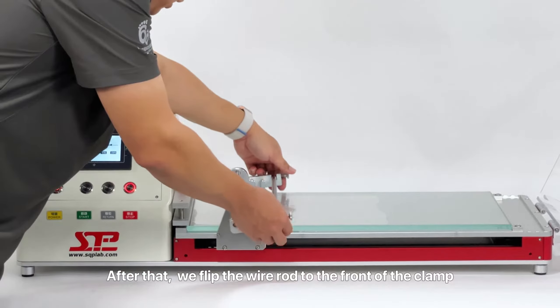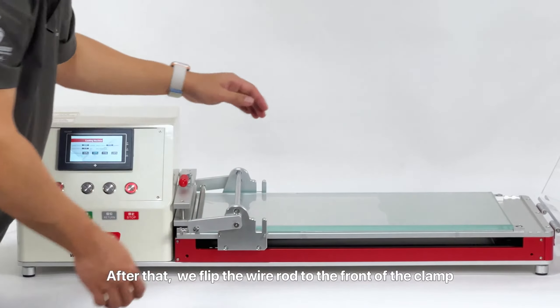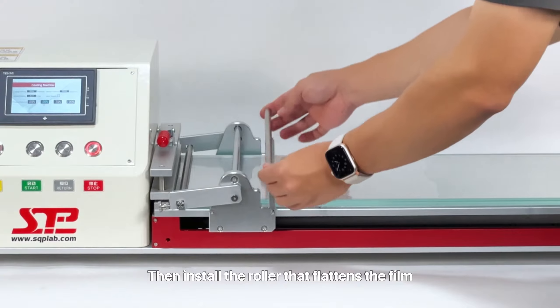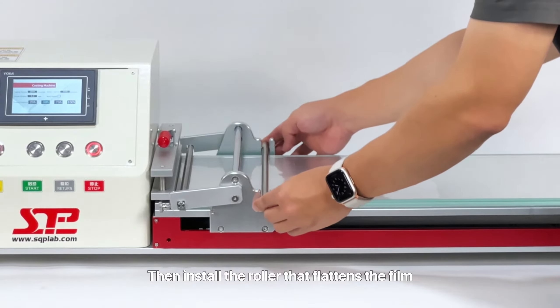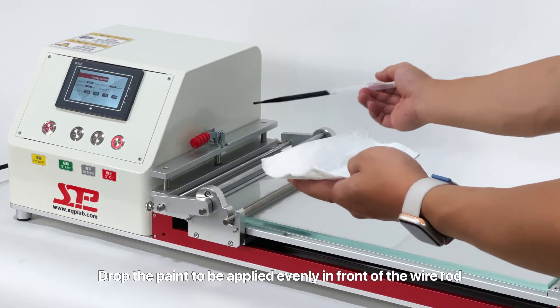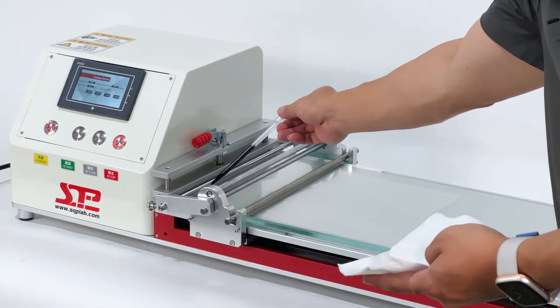After that, flip the wire rod to the front of the clamp. Then install the roller that flattens the film. Drop the paint to be applied evenly in front of the wire rod.